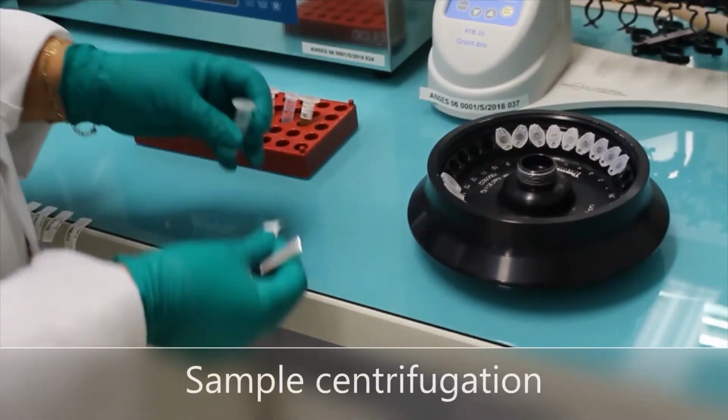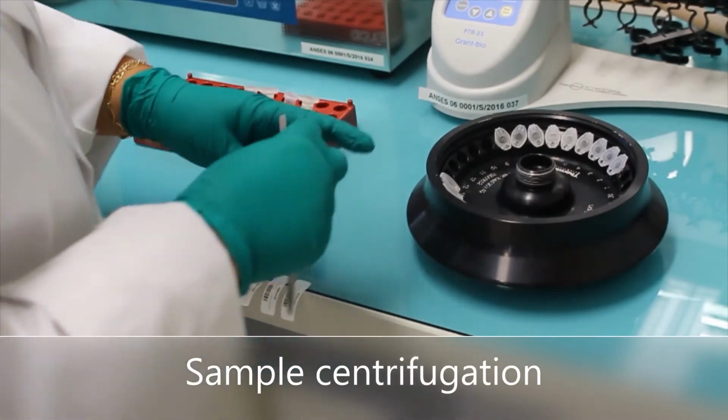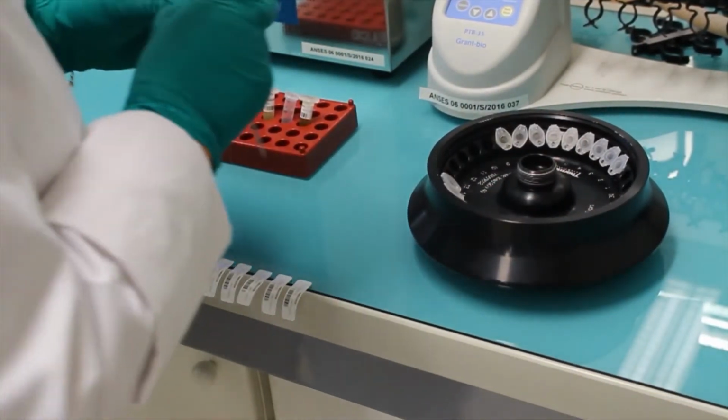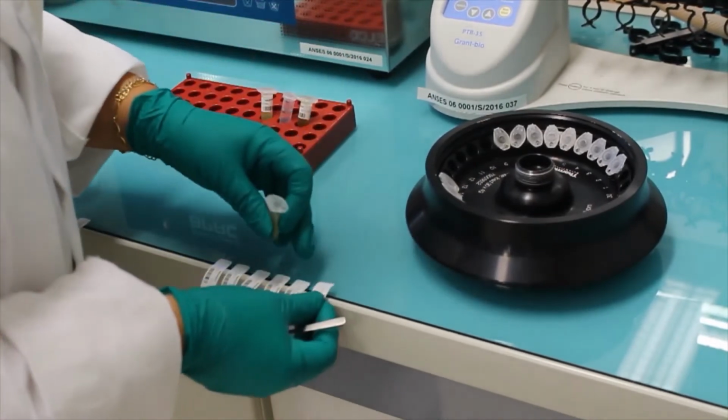The Eppendorf tube is then centrifuged at 10,000 RPM for 5 minutes to obtain a limpid sample.